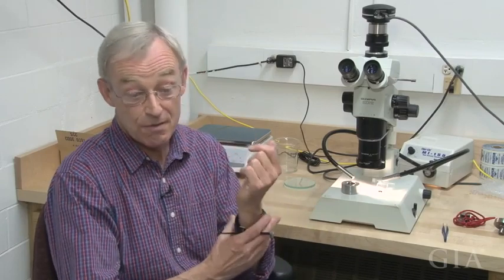Plus, we also can see some very interesting textural features about the inclusion. We can see if we've got a fractured inclusion, whether we have the whole inclusion, whether we have exsolution, if there's interesting exsolution features. Look at the diamond, the morphology of how the diamond induced its morphology to the sulfide. And it's just an example of a point in this procedure where you can get extra information which might be useful in the long run.